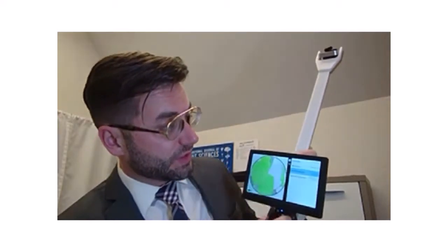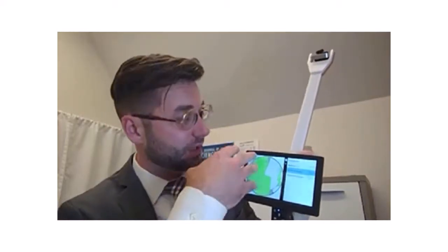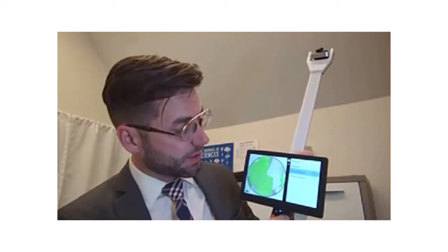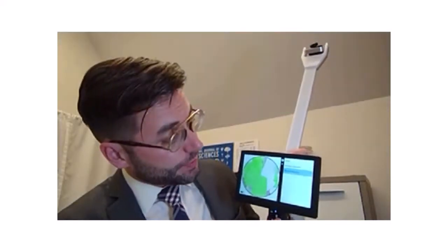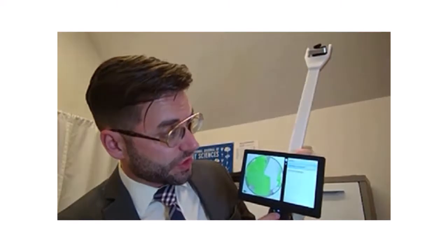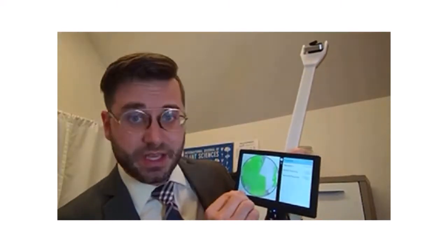As you're making your different images, you can also control the zenith divisions and azimuth divisions for your calculations. That way, if you're getting too much information in your camera light, you can order it any way you want by degrees, and only calculate the data you want in certain quadrants. Same with thresholding. We have several different options, including manual selection, Otsu, and entropy crossover, and these simply change the way it's calculated and decide between the light and dark particles.